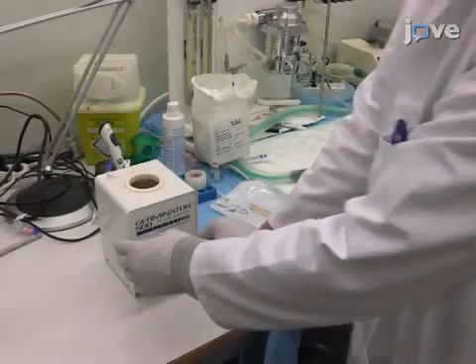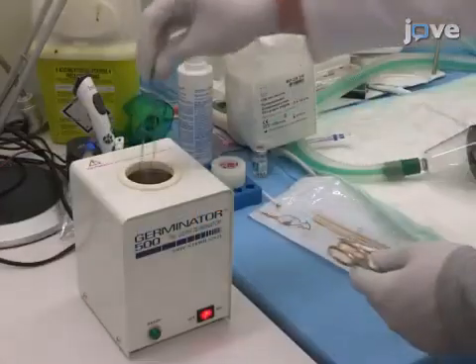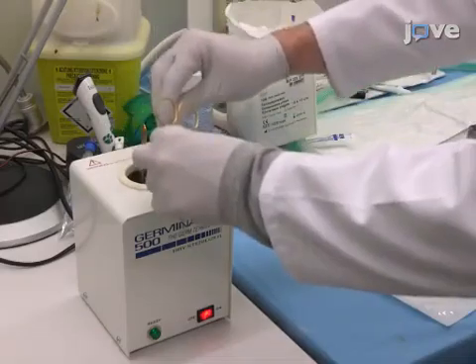Be certain to sterilize all the surgical tools using, for example, a glass bead sterilizer.